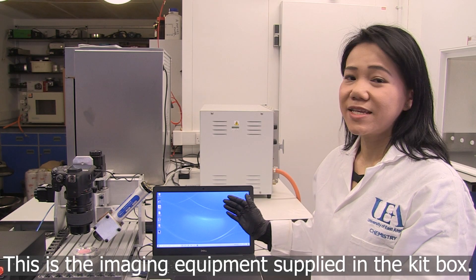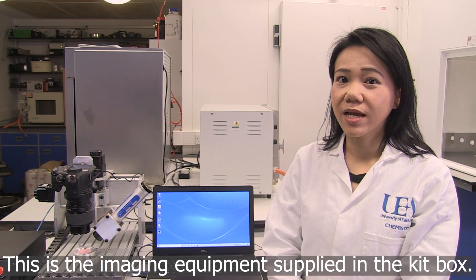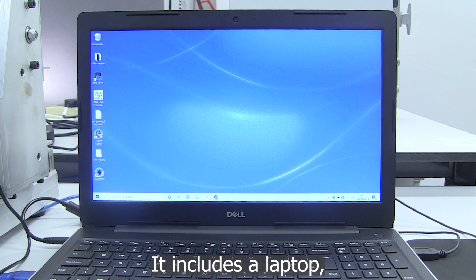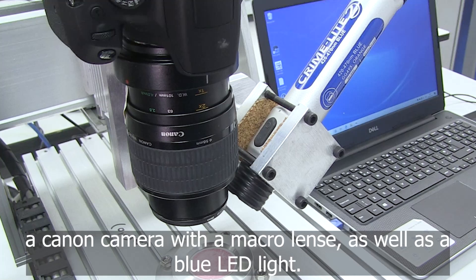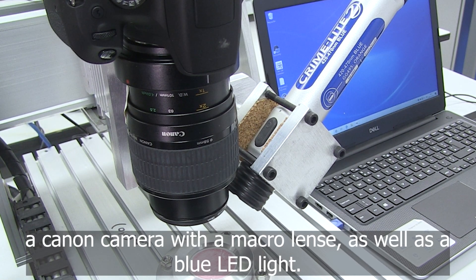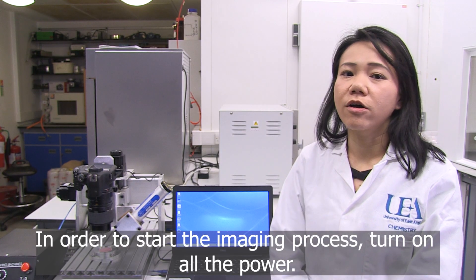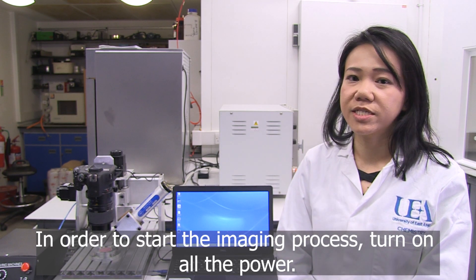This is the imaging equipment supplied in the kit box. It includes a laptop, an imaging rig with a control box, a Canon camera with a macro lens, as well as a blue LED light.